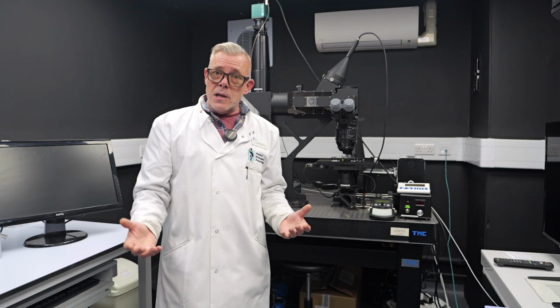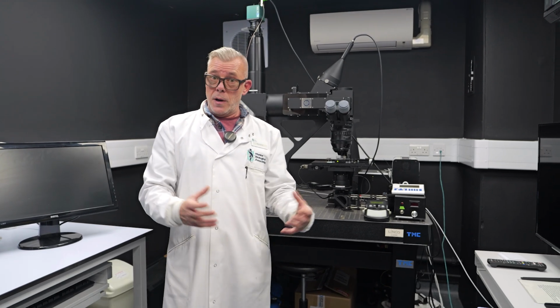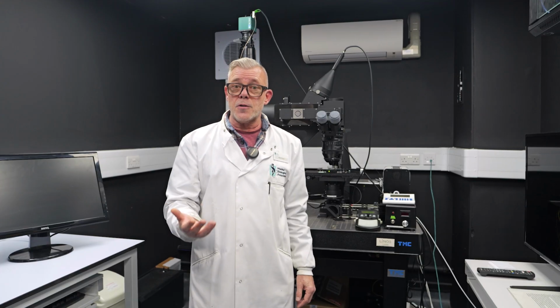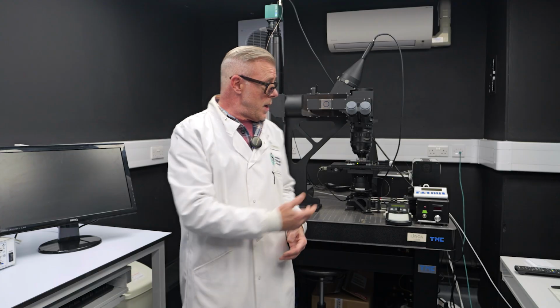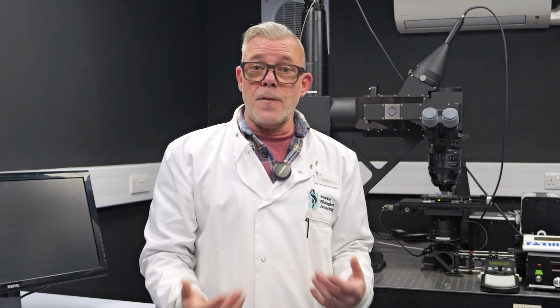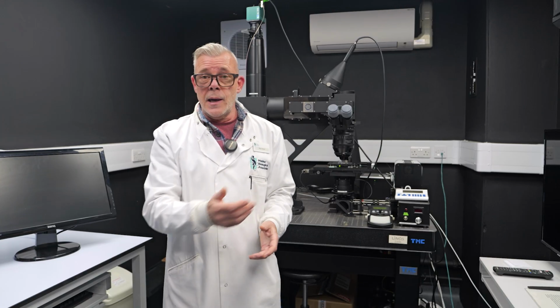More widely, the Mesolens microscope has been used to examine lots of physiological processes, both in large phytoplankton populations as well as multicellular organisms, anything from calcium signaling amongst phytoplankton populations as well as terrestrial leaves, right down to the opening and closing of stomata in leaves in combination with terrestrial leaf calcium signaling. We're going to be using the chlorophyll fluorescence imaging that we can produce on the Mesolens microscope to conduct a survey of the photosynthetic efficiency of phytoplankton sampled from the Western English Channel right here off the coast of Plymouth.